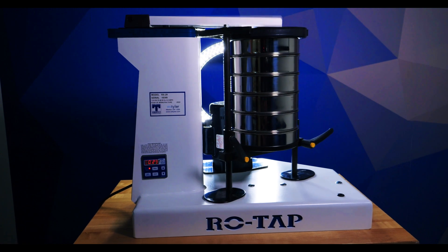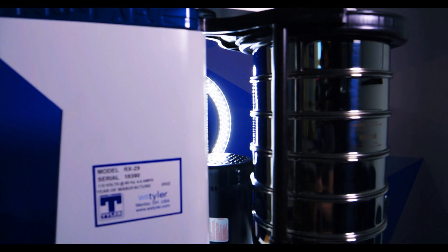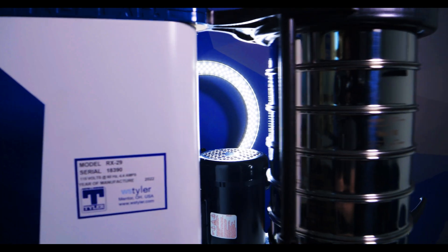Record the amount of sample retained or passed on each sieve. Using the same sieves and the same sample, run the test again, incrementally longer — usually adding one to five minutes to the initial test time — and record the results of the sieve analysis. Repeat this process, adding incrementally more time to the ROTAP timer until the results of the sieve analysis stop changing by more than half to one percent. This is the end of sieving. Running the test any longer will not significantly affect the results in the analysis.